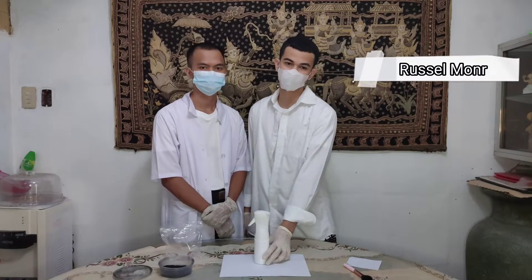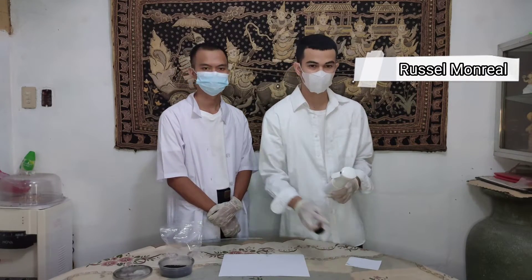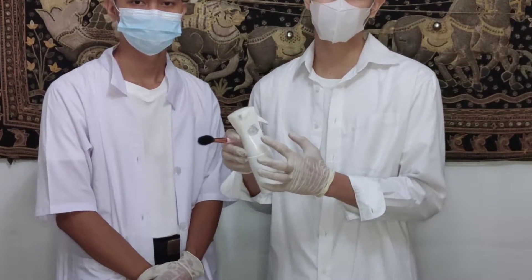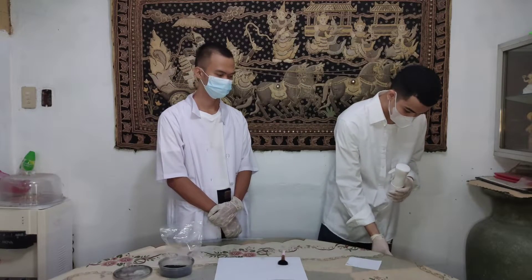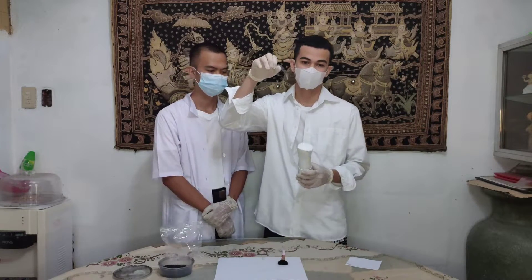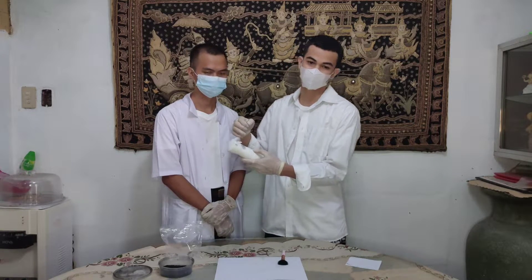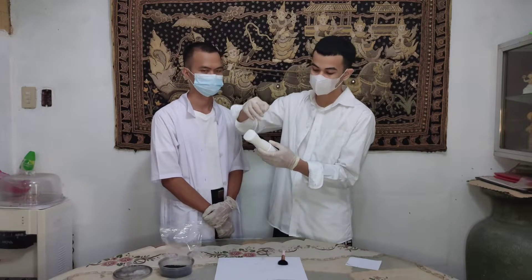After dislodging the charcoal powder, gently brush the excess powder from the item with the fingerprint. This is the fingerprint mark. And by the use of lifting tape — this is the lifting tape — gently place it to the surface and make sure the tape covers the visible fingerprint mark.